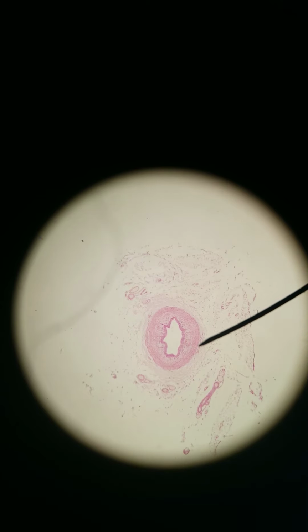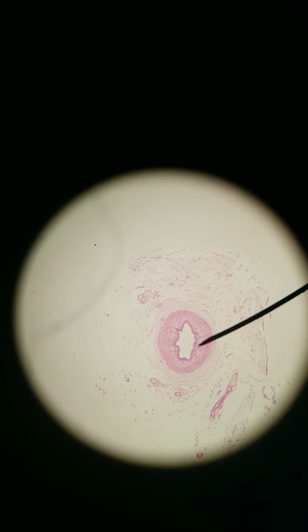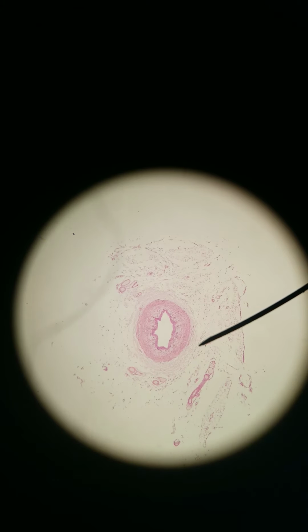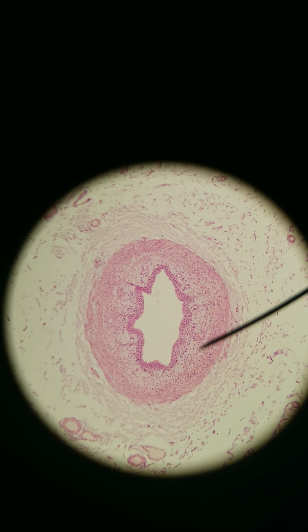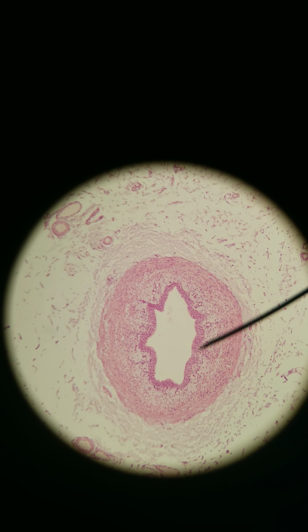And this slide, we're at 40x right now, we are showing the ureter. So you can see the lumen of the ureter here, epithelium, smooth muscle, and remember ureter is retroperitoneal, it's the U in SAD PUCKER, adventitia, the dense irregular. So let's take a closer look. There's our ureter. The darker part, this darker layer here, that's the transitional epithelium.